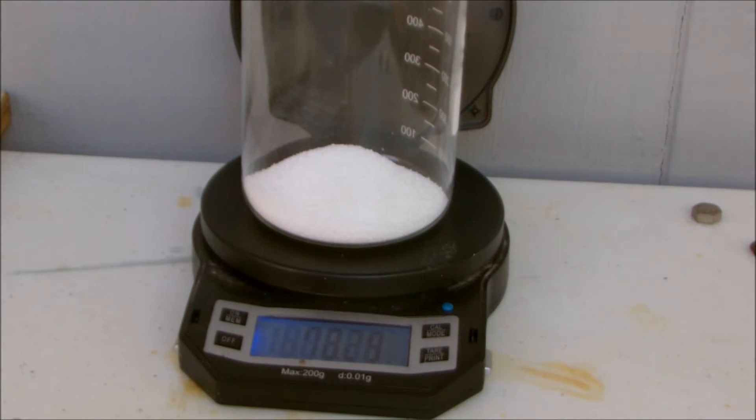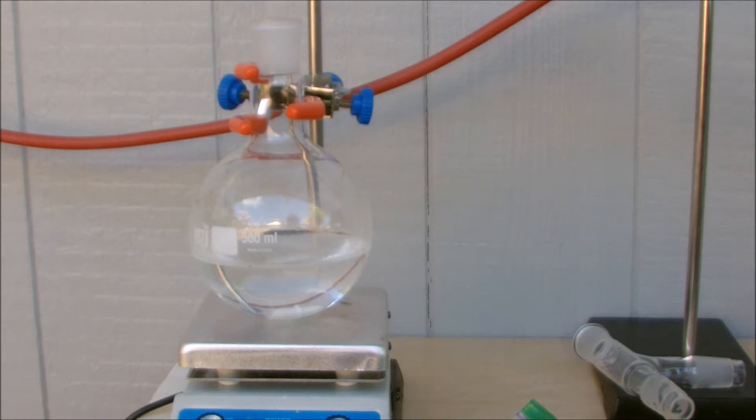At this point, you're going to need to put on your gas mask. Now we're going to add the sodium dichloro isocyanuric acid and put on your gas mask like I have on right now.